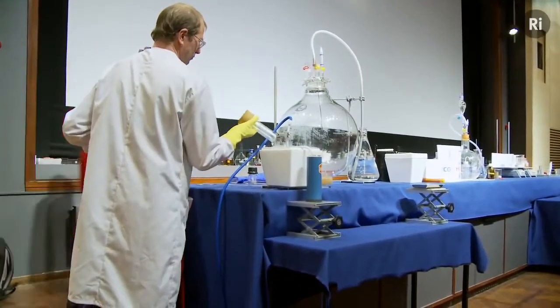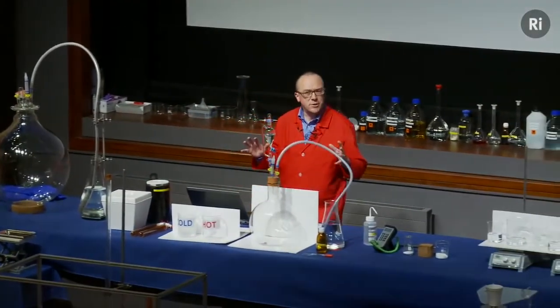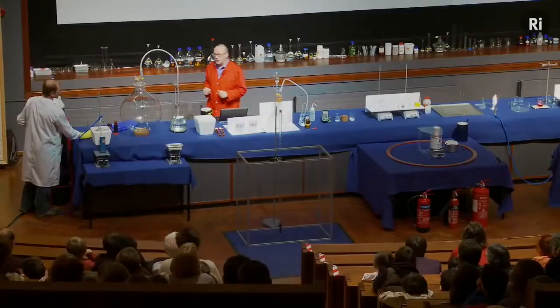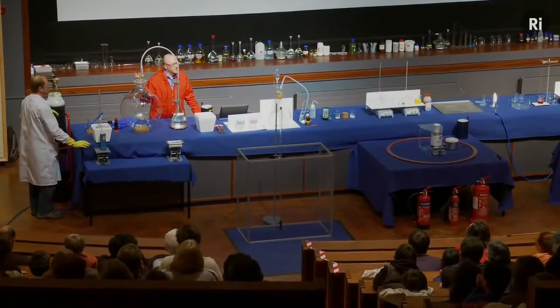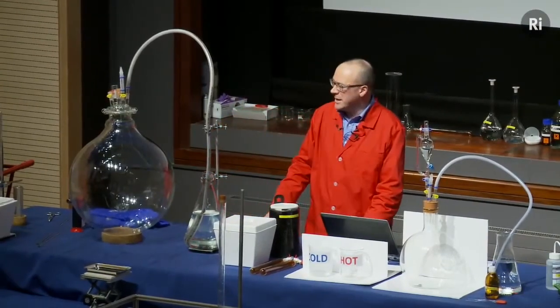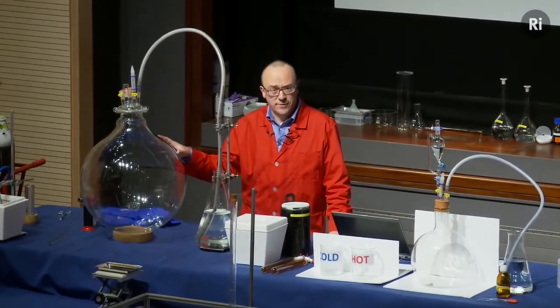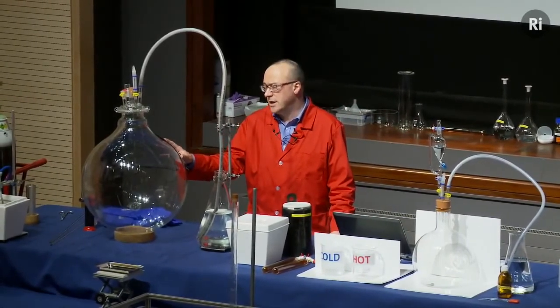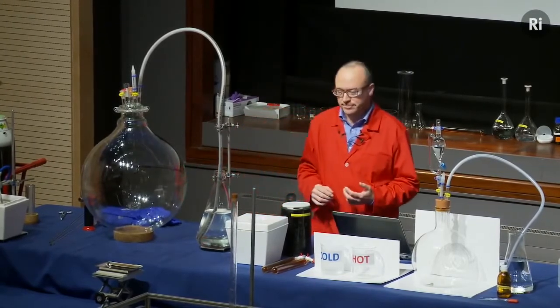So we could just burn a little bit of phosphorus on the bench, but what we thought we'd do is to scale this up and do this on the largest scale we could. And so this is actually the largest flask that you can buy in the UK. And so this is about as big as we can make it. And we're going to burn quite a big chunk of white phosphorus inside this flask. And to make it burn really well, we're going to fill the flask with pure oxygen.